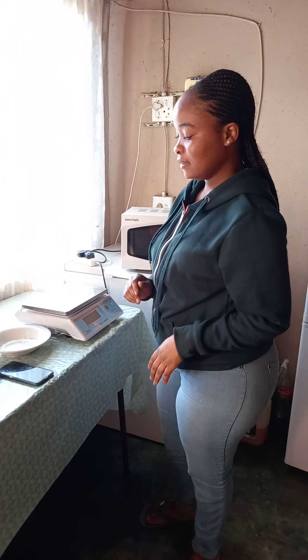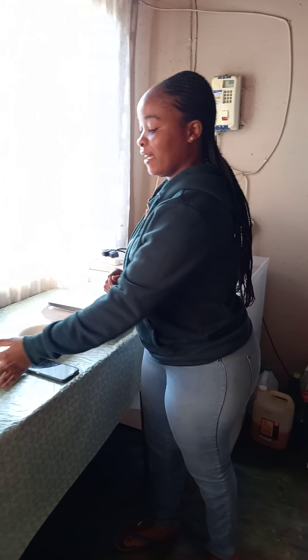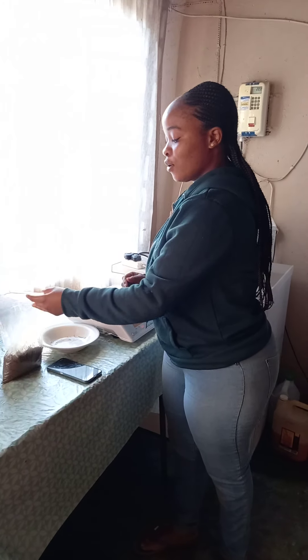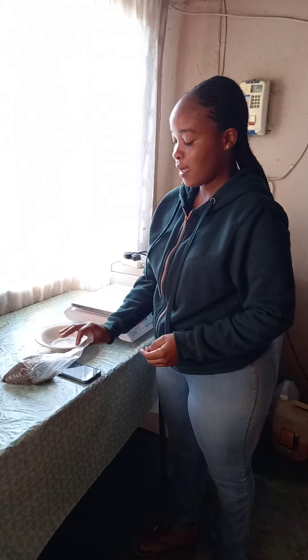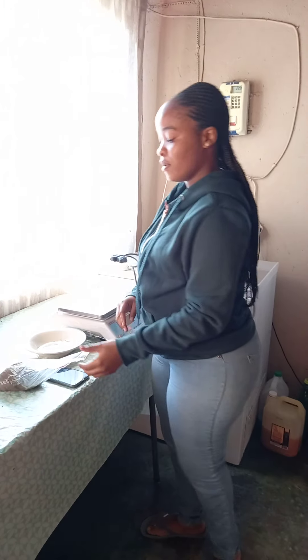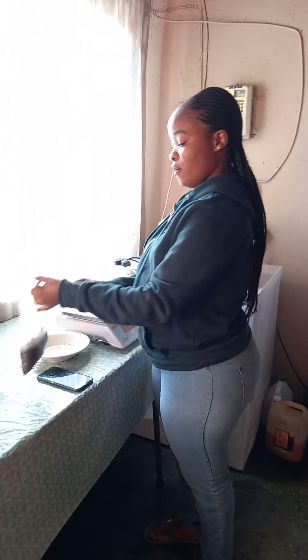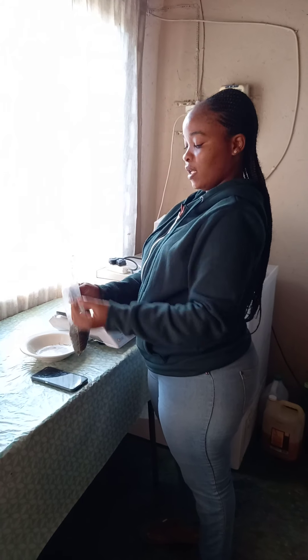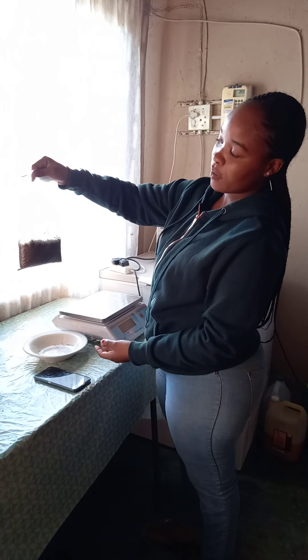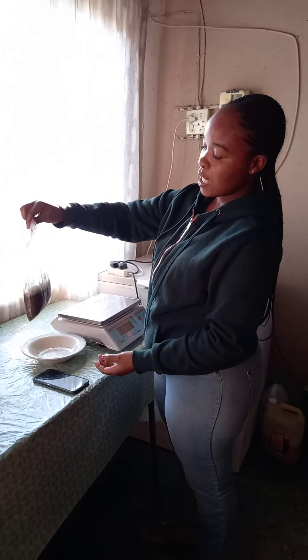Good day everyone. I'm back. As I told you last time, we were doing a project on bulk density. So now I'm here weighing our soil. This is my soil sample that we collected.